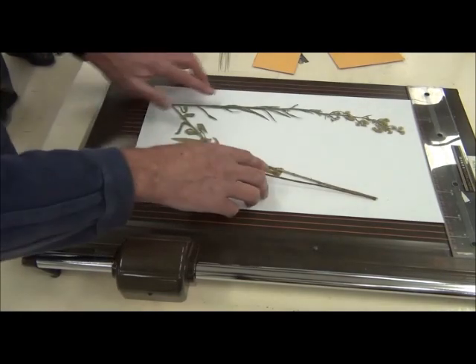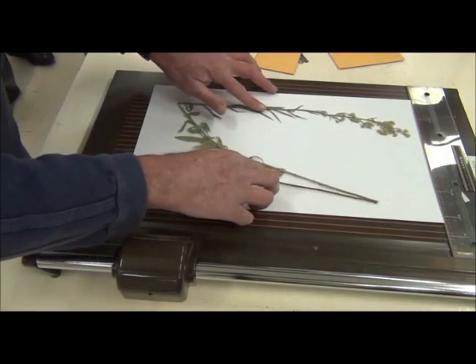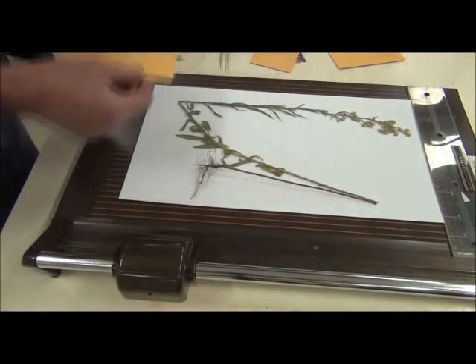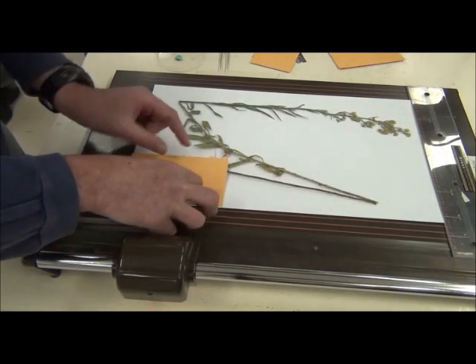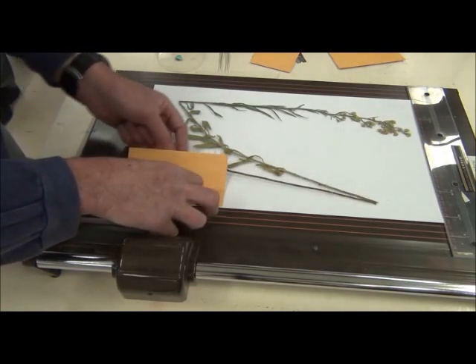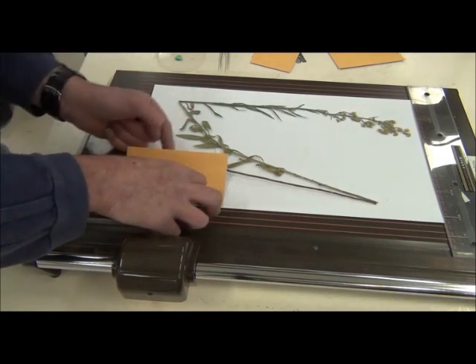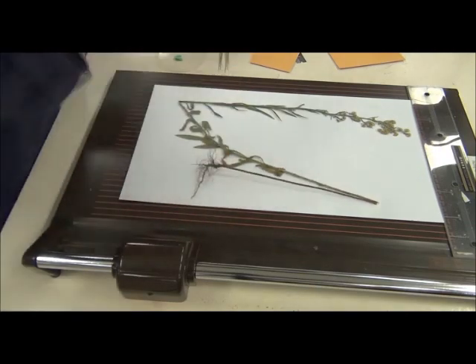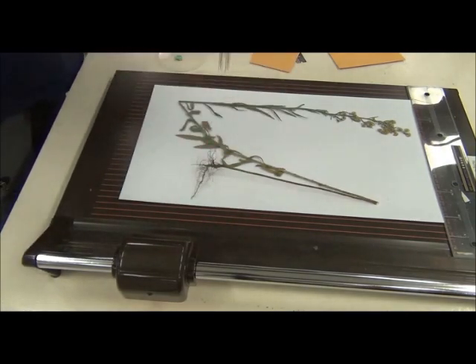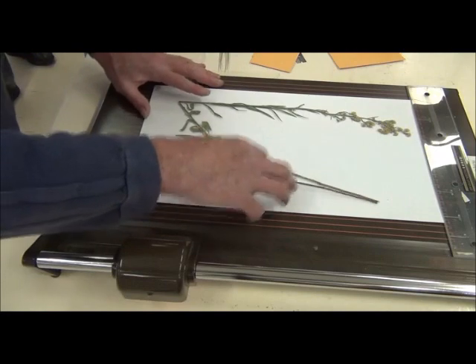Now that's fine, the specimen I can move up, the label in any case will flip over there remember. And it's not such a big deal that I can't see the base because I can always lift up the label to have a little peek later on if I need to. And it's there, that's the main thing, it's there, nicely presented.